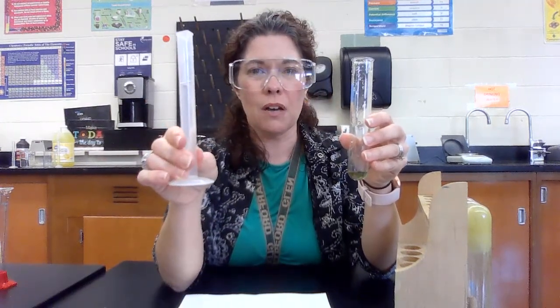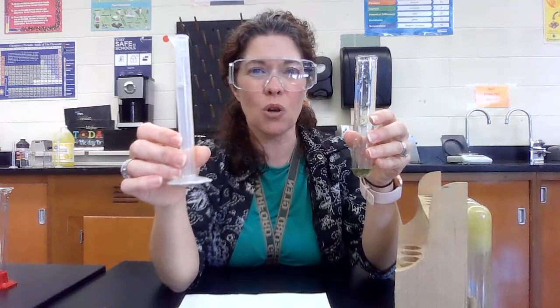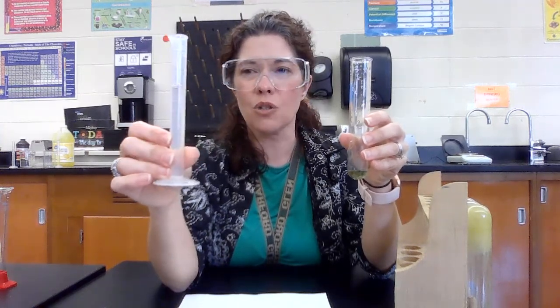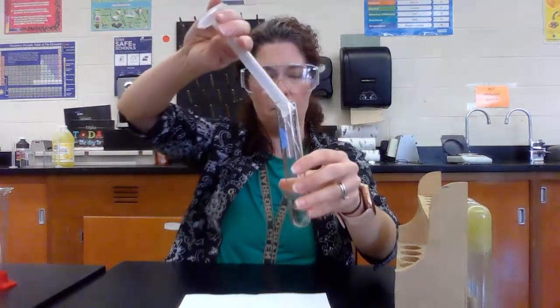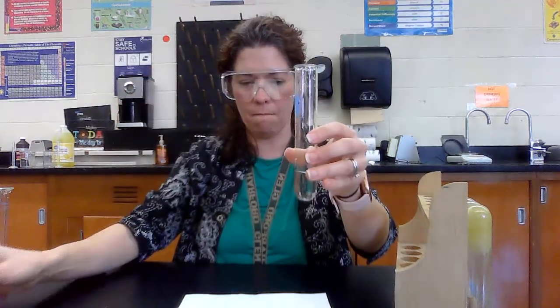To that I'm going to add 10 milliliters of magnesium sulfate. Magnesium sulfate is just a clear liquid — it's an Epsom salt, something you can have in your house. So nothing special here, just a clear liquid of magnesium sulfate. We pour that in.